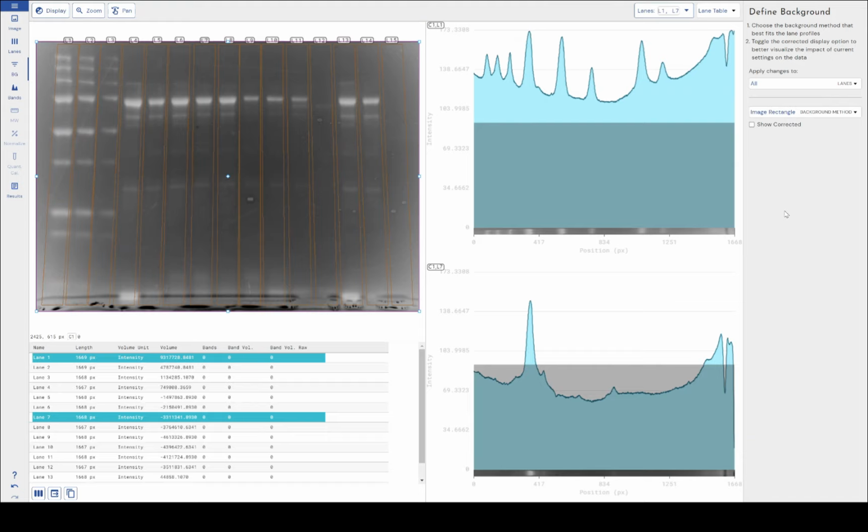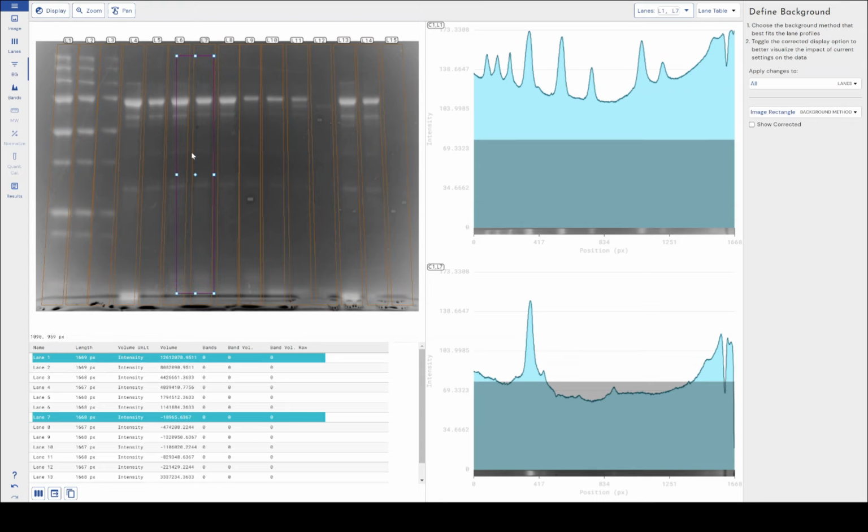Image rectangle is a very old school way of doing this. Now, a lot of software still relies on image rectangle. We include image rectangle to accommodate users that may still be using this technique. It's typically used whereby in the experimental procedure, a user has left a lane or multiple lanes of their gel blank. The idea being that you can get this rectangle that we've got highlighted in purple here and spread it out across your blank lane, if I imagine this lane is blank, and then use that blank lane as your background value. The thought process being this blank lane has been through all of the imaging and experimental procedures that everything else has, but without any sample in it, therefore it should be background, right? It should be empty, it's considered empty.